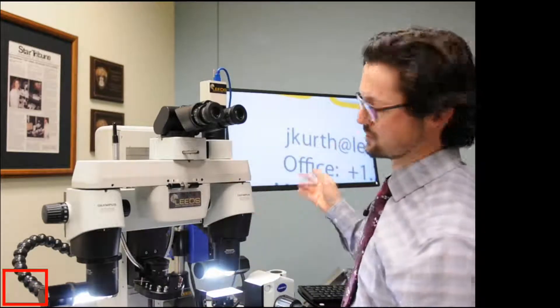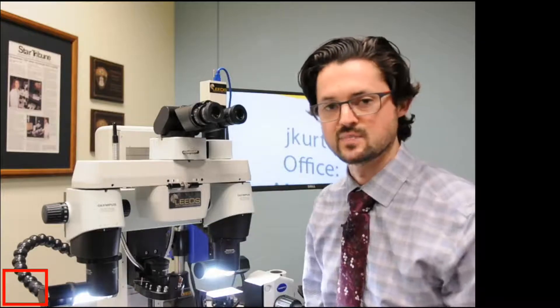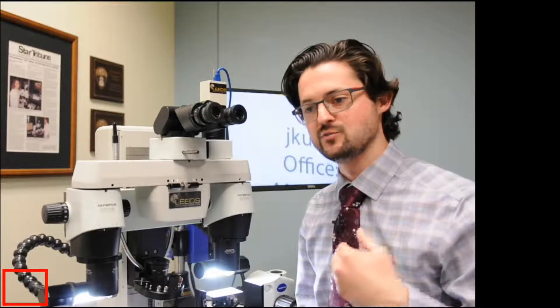When you look through the microscope, look at the camera, everything agrees there. But it's also really helpful if you share microscopes.